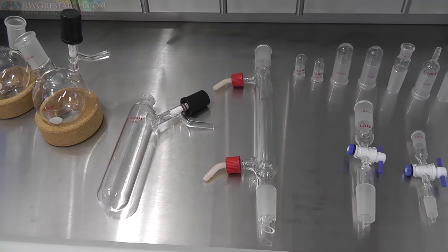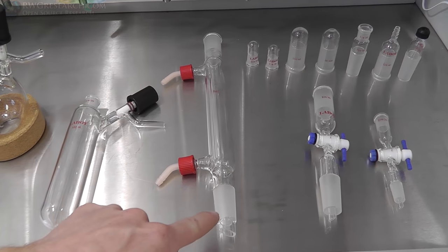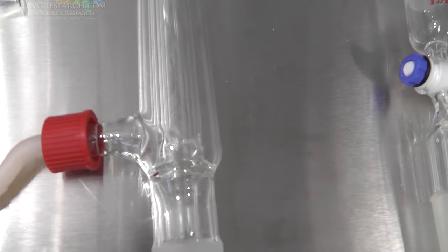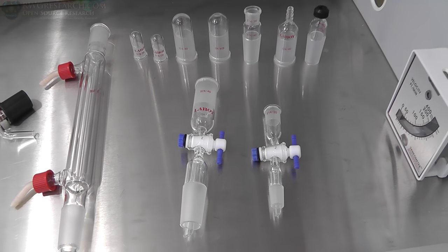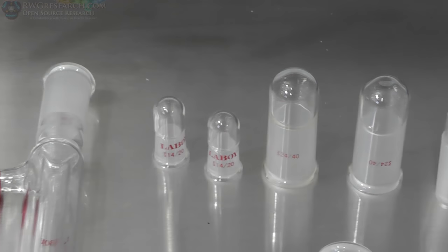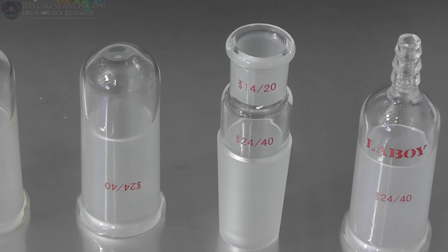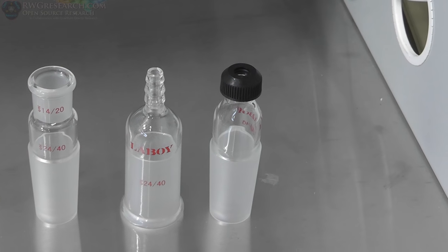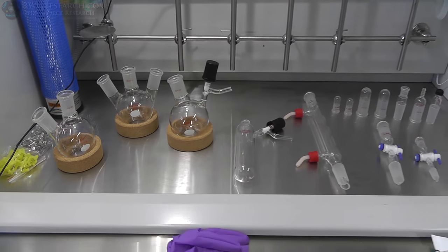This here is actually a distillation tube. So you've got water running in a jacket, and then you've got your main plumbing going through the middle. It's hard to see, but there is actually an extra pipe there. Then you got a couple of PTFE valved fittings and some adapters. These are caps. That is an adapter for the small size to the big size, in my case a 14/20 by a 24/40. There's one for a pipe outlet, and this is actually an adapter for a thermocouple or thermometer. So this is just some of the generic pieces you can find.